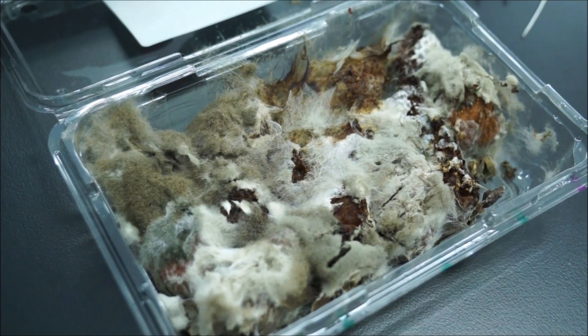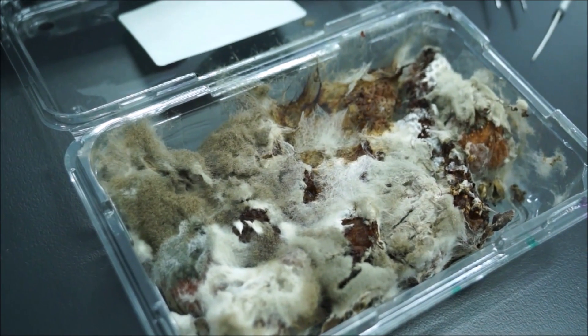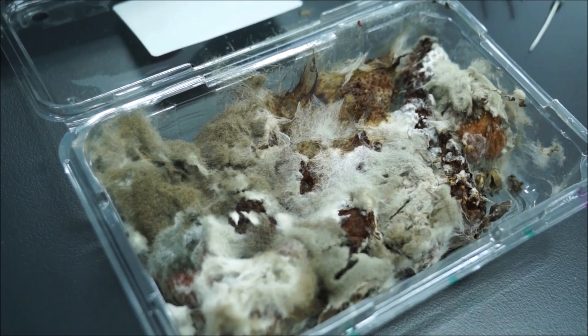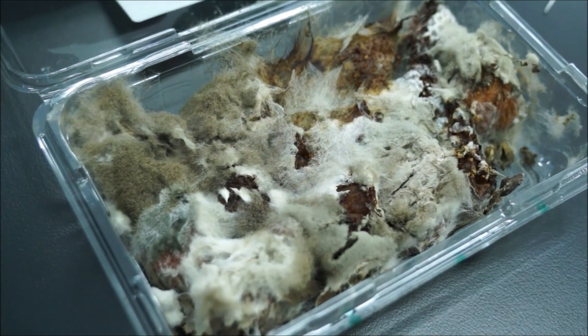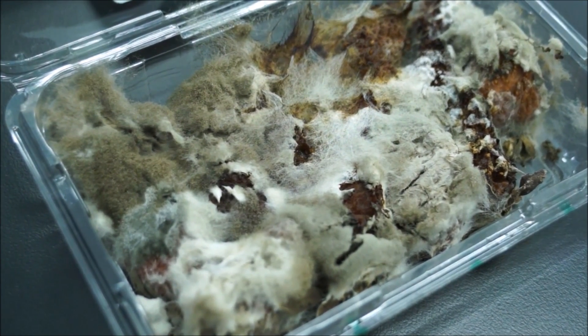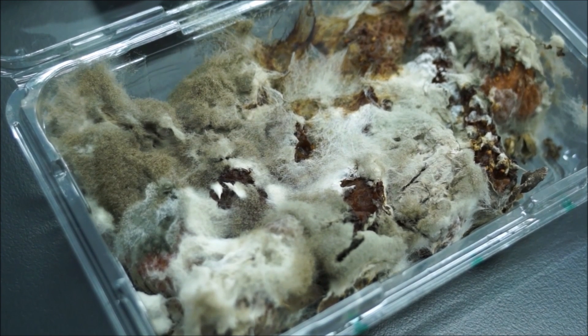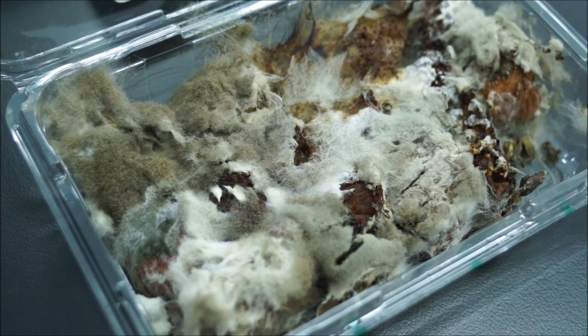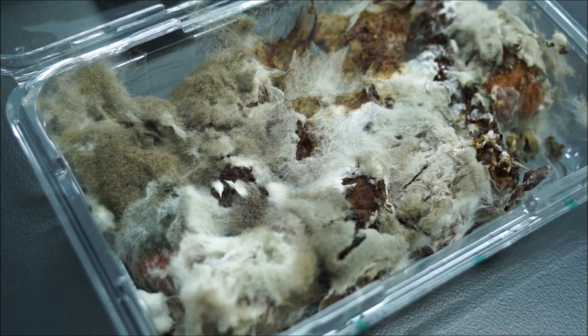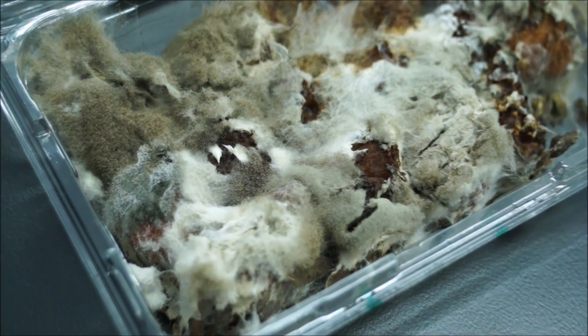So believe it or not, this used to be a punnet of strawberries. We find that strawberries grow Rhizopus really well, although they will grow on a range of different food substrates. What you're actually looking at here is a few different organisms, and you should choose the correct one.